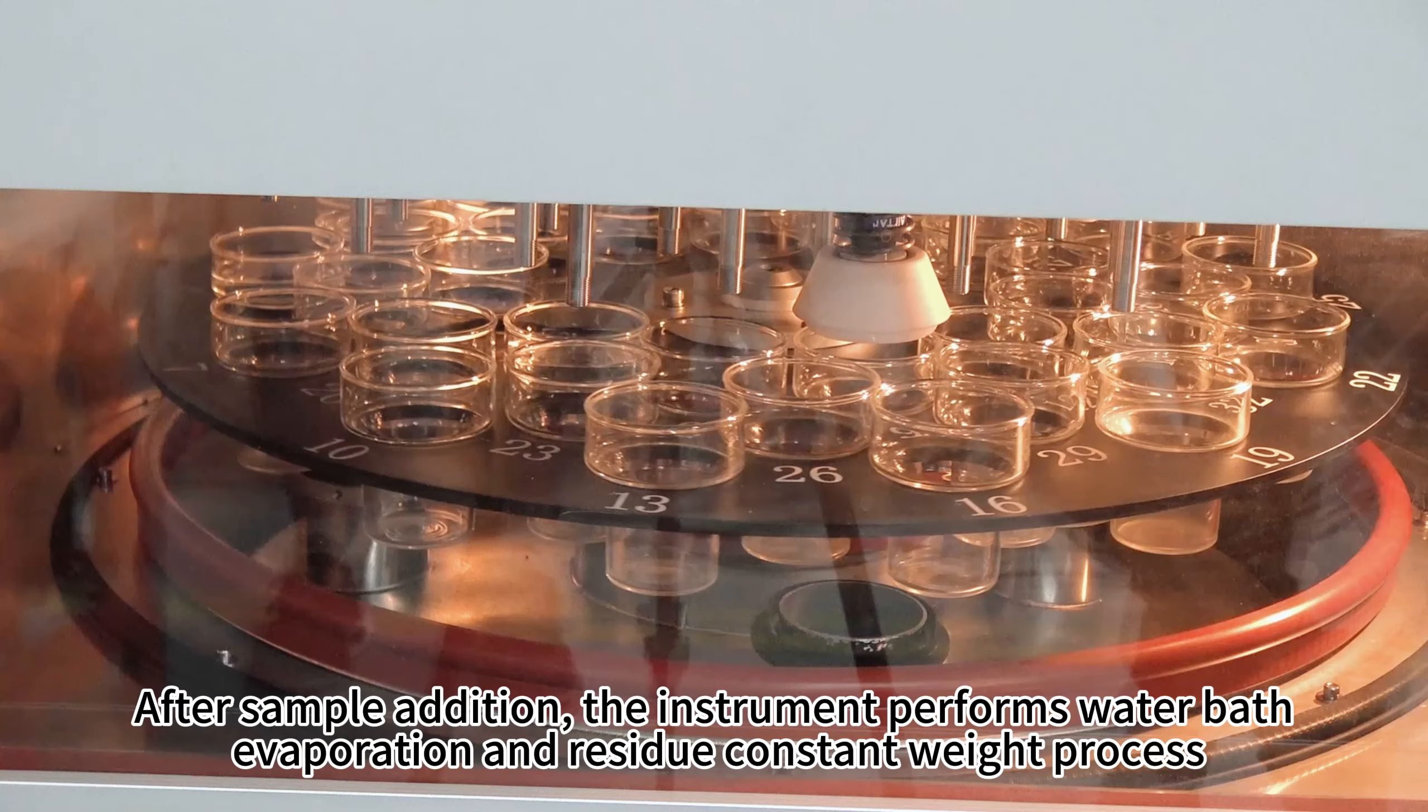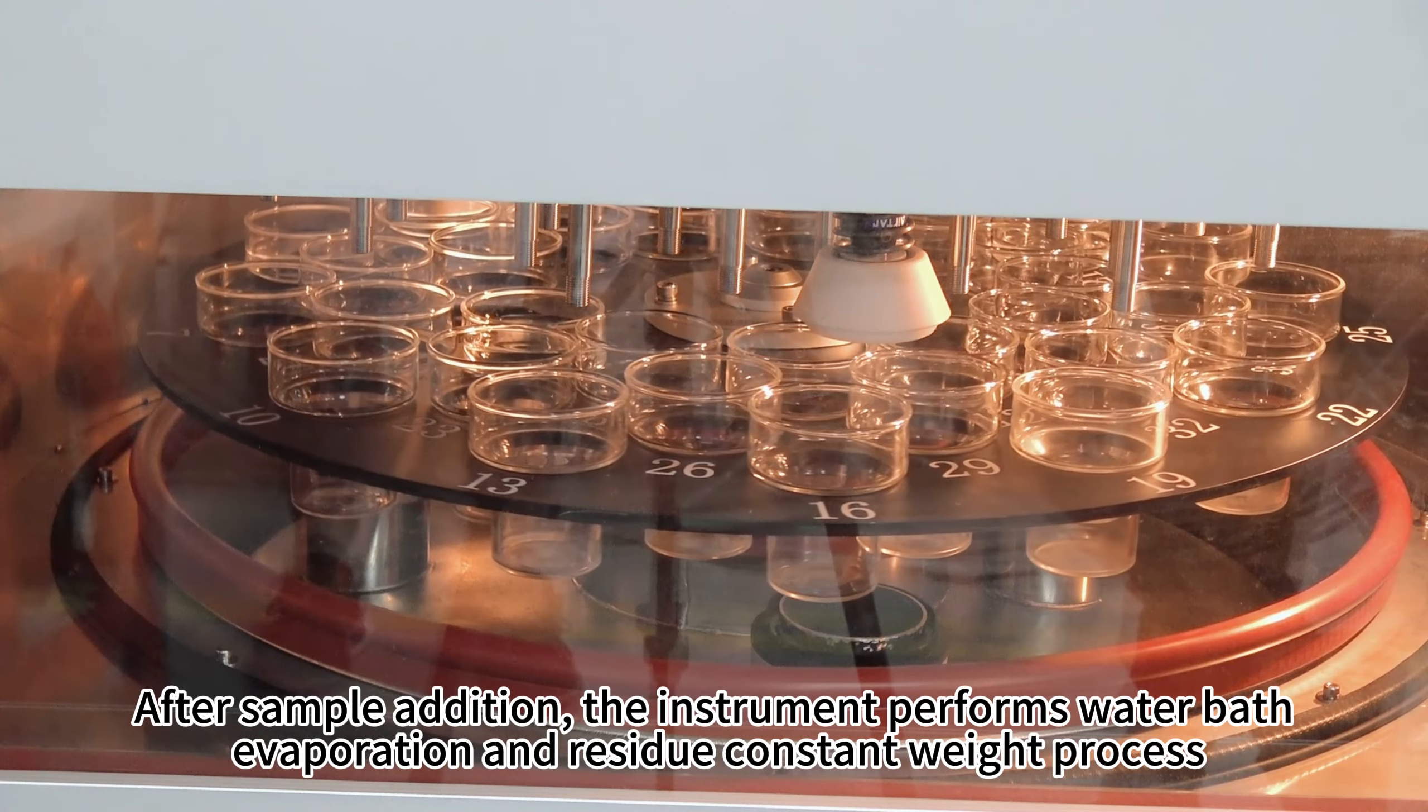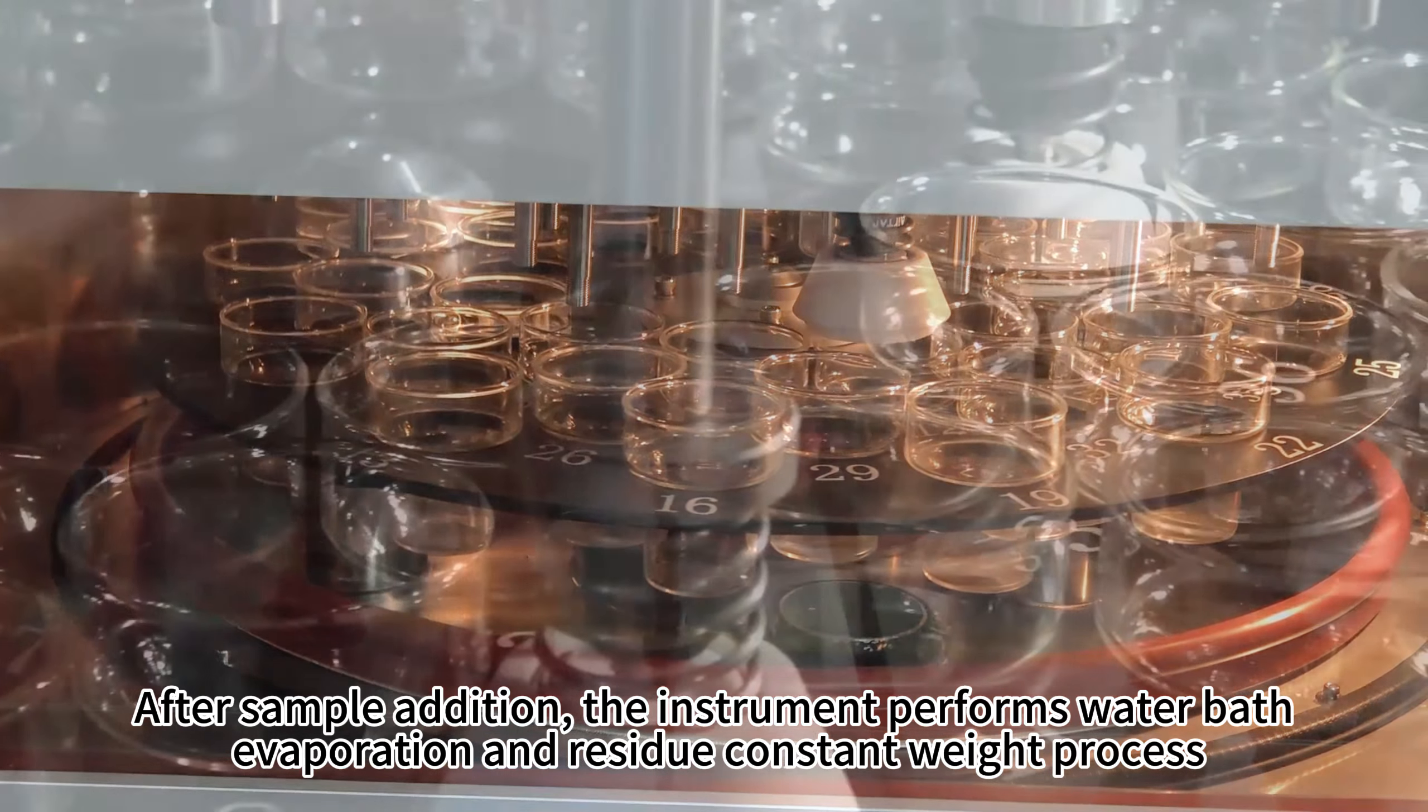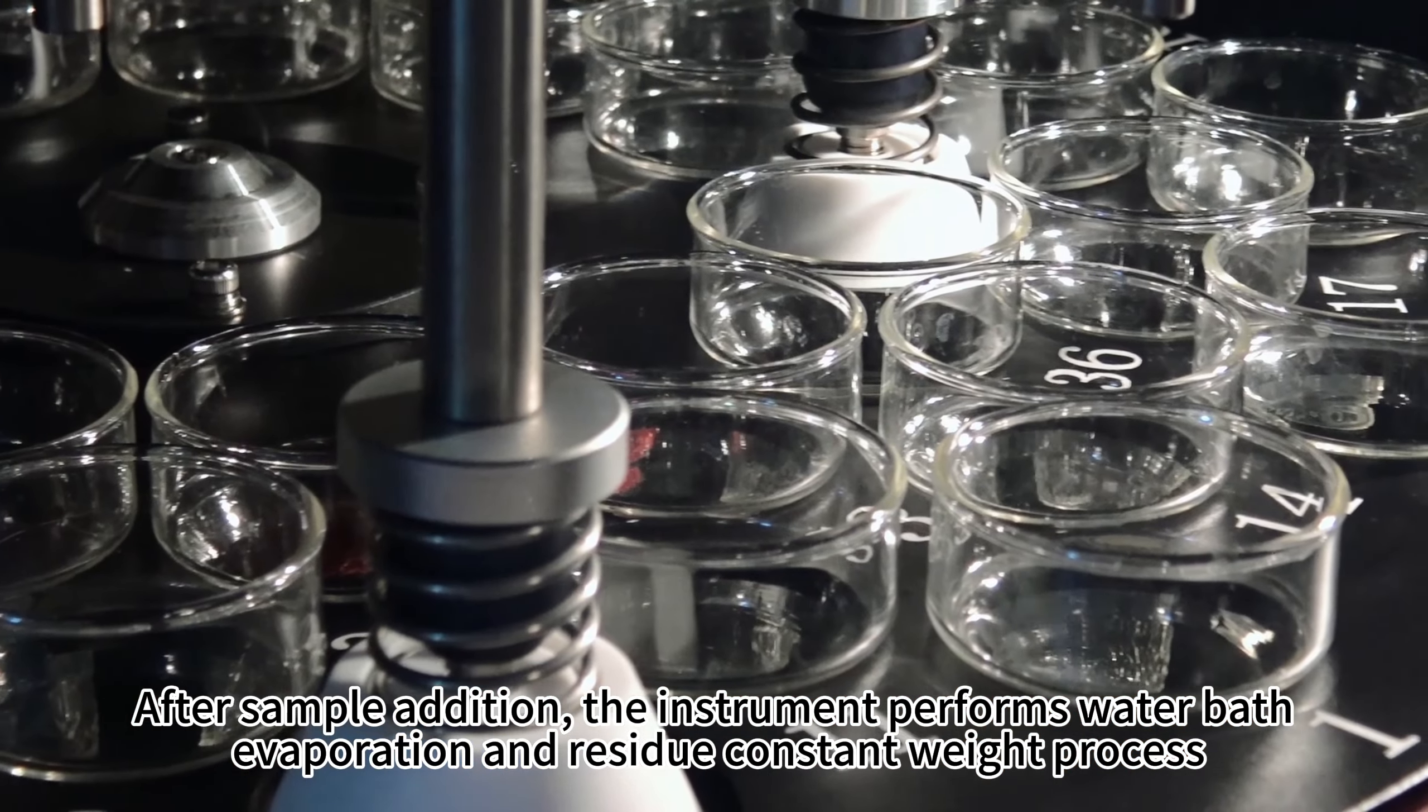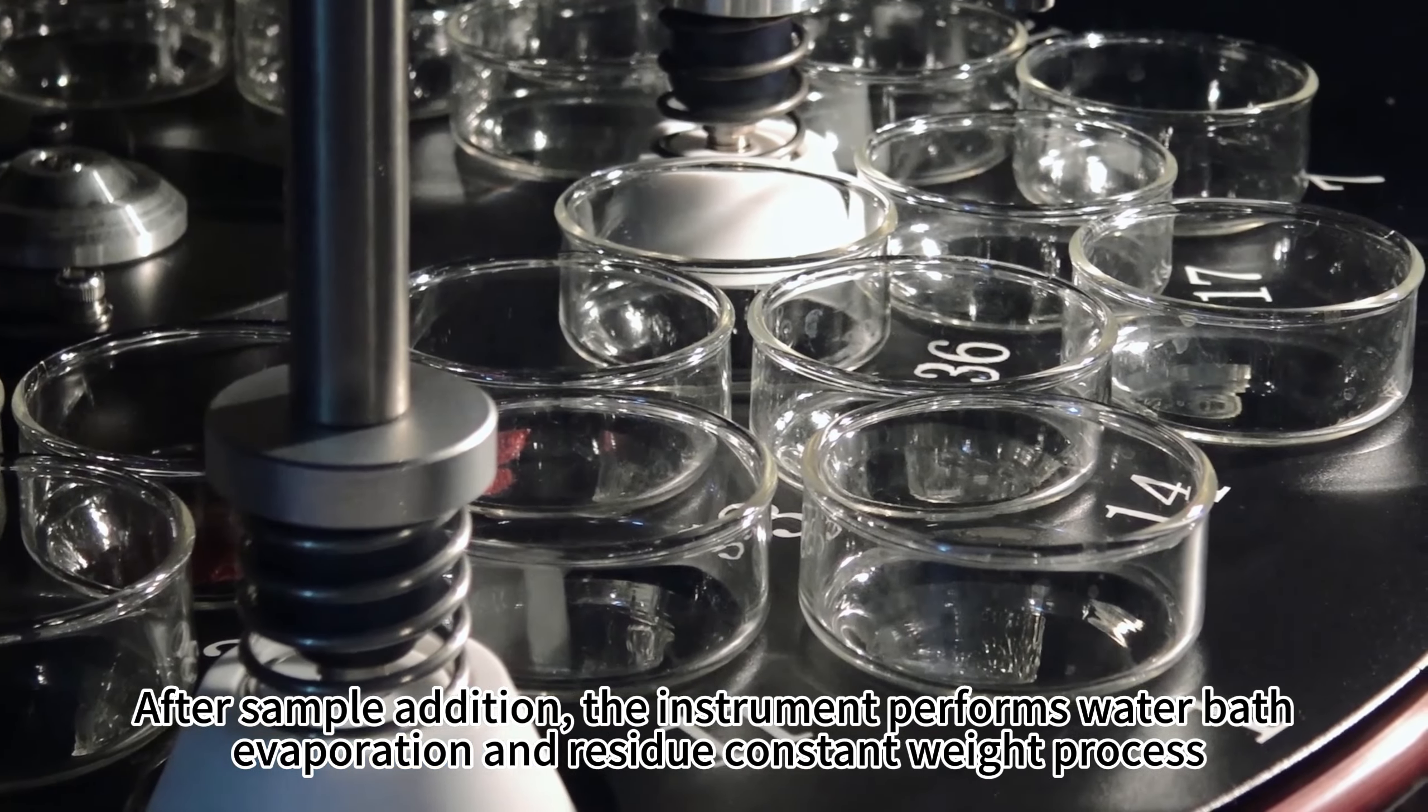After sample addition, the instrument performs water bath evaporation and residue constant weight process.